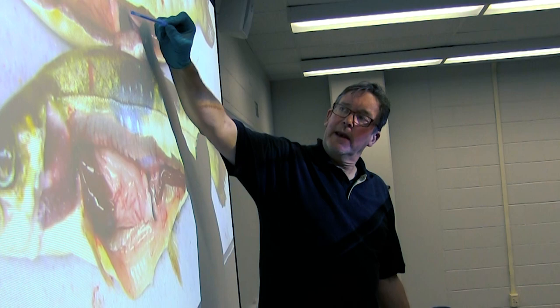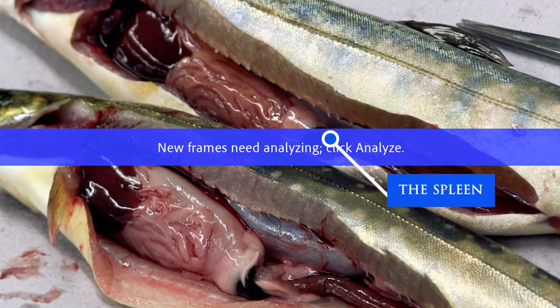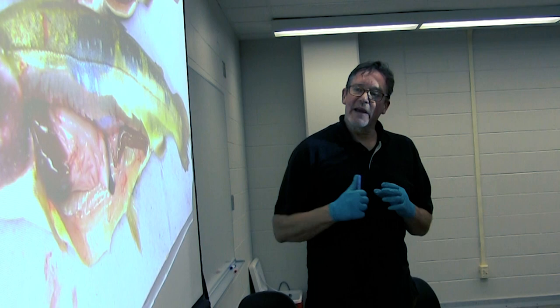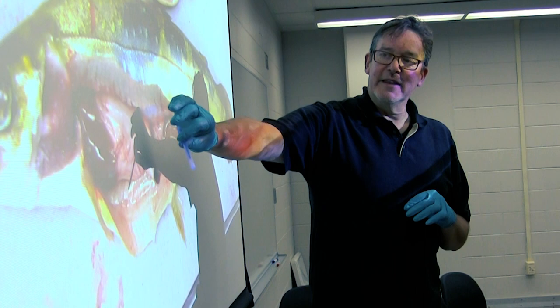There is a dark cherry-red mass here — that's the spleen. The spleen is associated with the immunology of the fish; it filters the blood but also has cells involved in developing an immune response. It can be a challenge to interpret, and you'll see variations in size that can present a challenge.